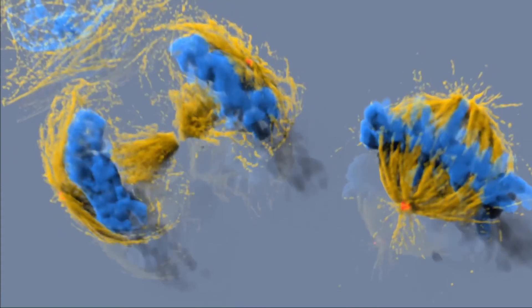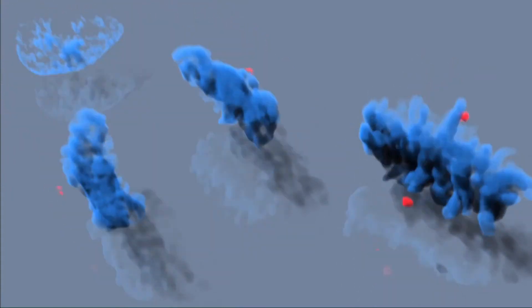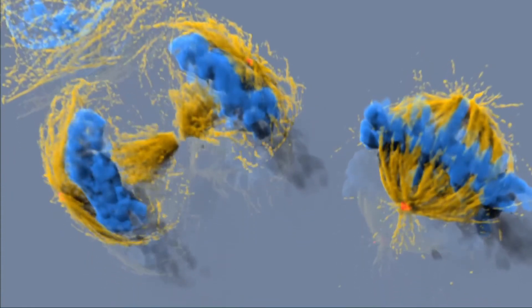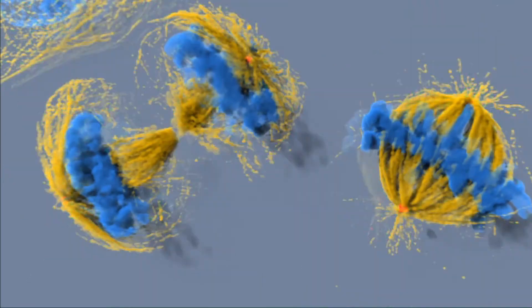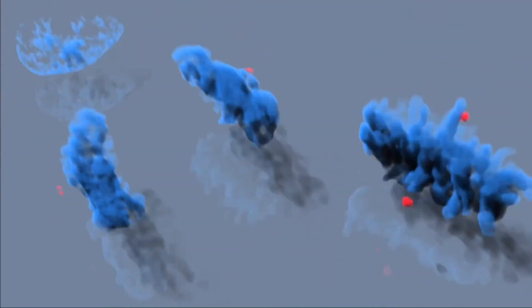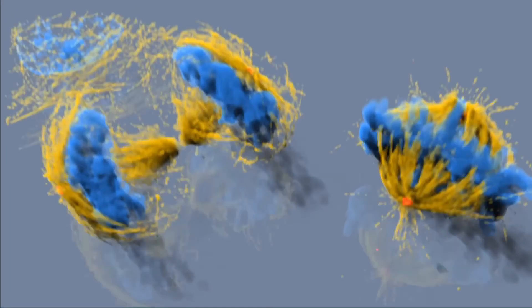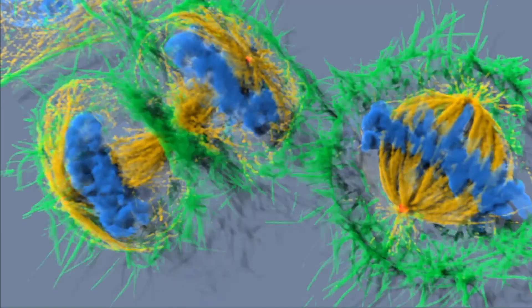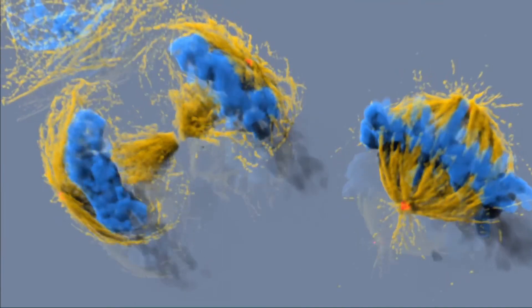High quality SFP MIP rendering in Huygens shows cells undergoing division. A shading and reflection table offers a very realistic 3D perspective. Crucial for the proper visualization of this wide field dataset is again deconvolution.